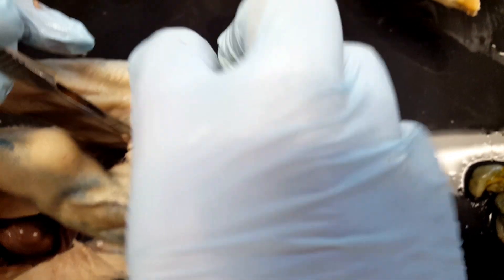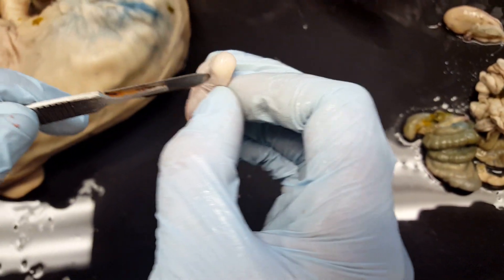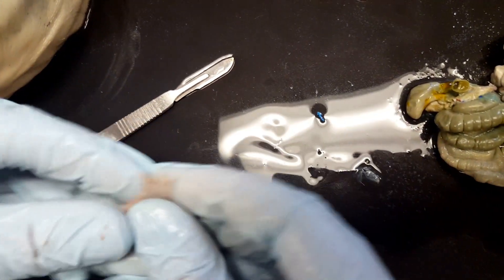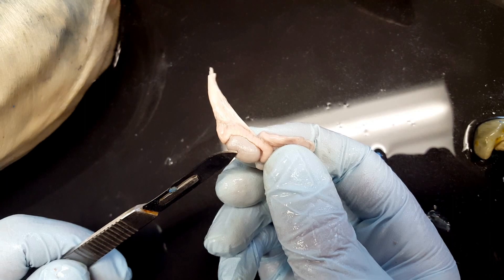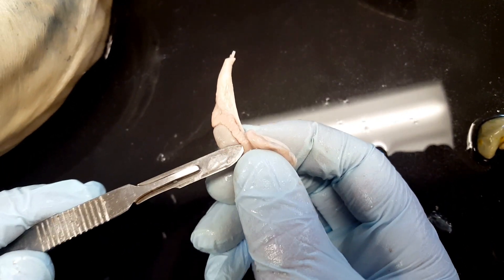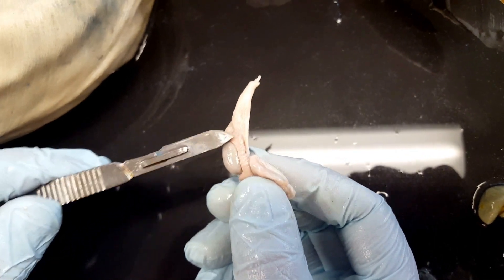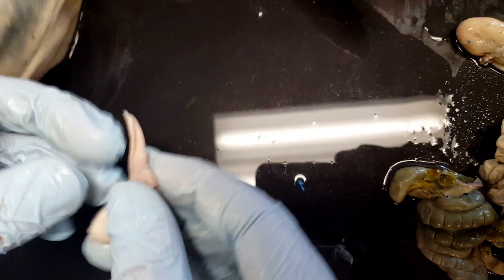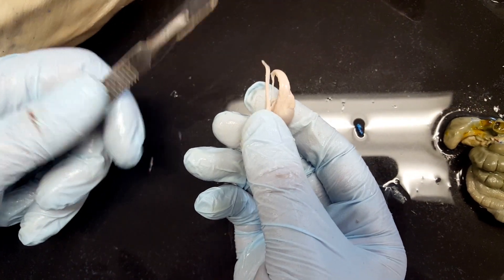Because this is a male, we can go ahead and dissect the scrotal sac to look at parts of the male anatomy. I'm just going to cut out the whole testes here. There's going to be connective tissue surrounding it; we're just going to cut that off and expose the full part of the male reproductive structure. This bean-shaped organ is going to be the testes. Around it is the epididymis, which is coiled in appearance. Sperm is going to travel from the testes into the epididymis, and then the epididymis ultimately connects to the vas deferens — the tube that runs to the penis.